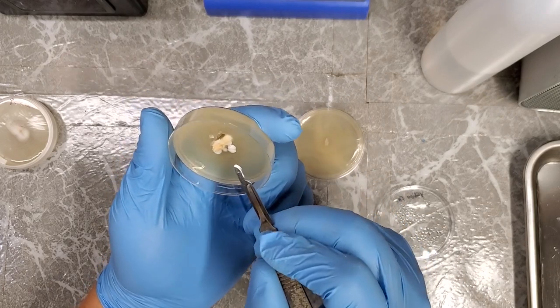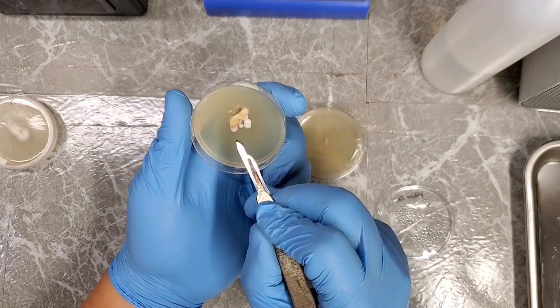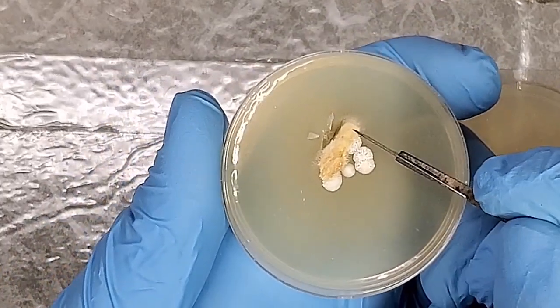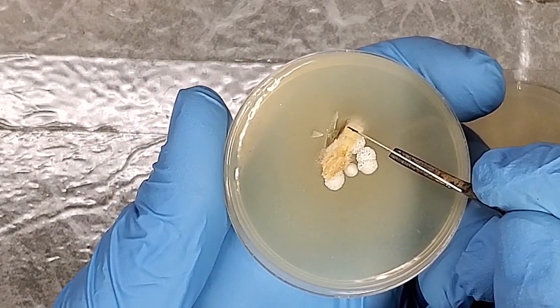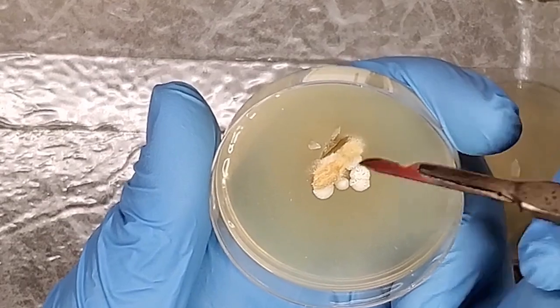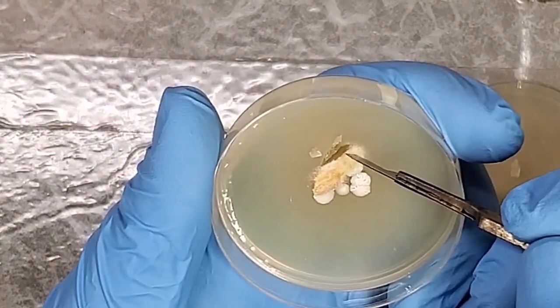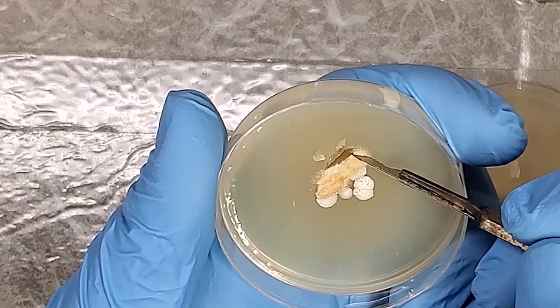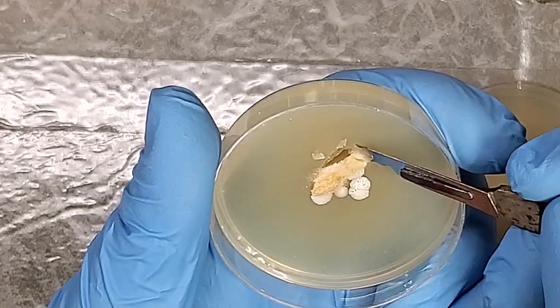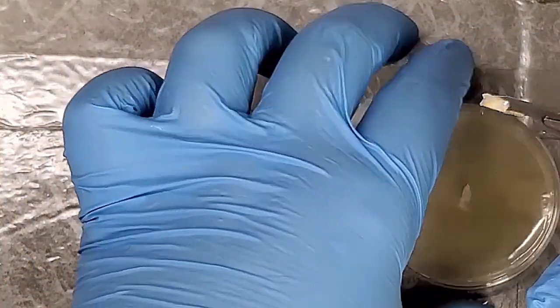Let's pretend that the only good part of this mushroom culture, like say that every other thing that you did failed, or let's say that this part right here is the only piece that didn't get contaminated yet. And we're also going to pretend that this scalpel is perfectly sterile, like we didn't just make that cut right there. Well, you get the idea. So what we're going to do is take a very tiny sample from that clean area. In this case, the smaller the area, the better.